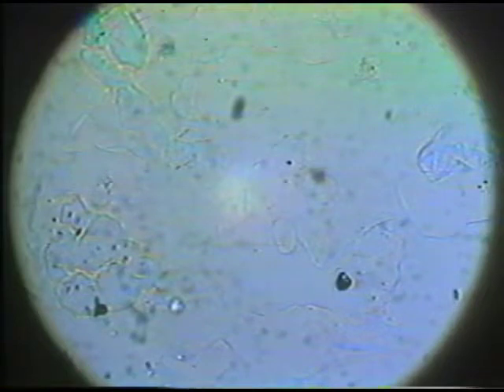I'm going to open the diaphragm again and put our accessory plate into the accessory slot until part of the field is blocked. And now I want to look at the colors that I see on the edges of the grain. These mineral grains show around their edges now what we call color fringes. These color fringes occur when the mineral grain is very close to the refractive index of the mounting liquid. These particular color fringes are slightly yellow in color.